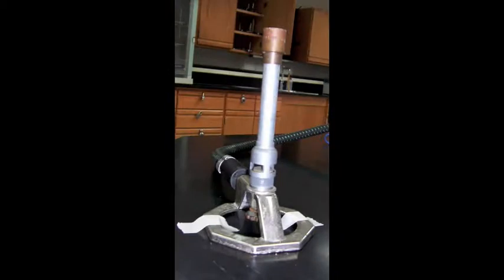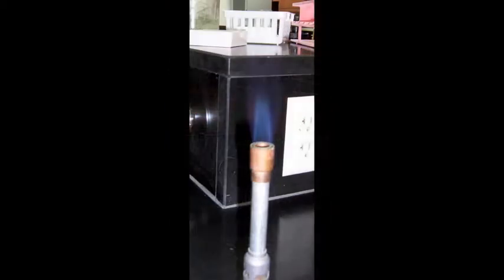Now, light your Bunsen burner and adjust the flame so that you have a nice inner light blue cone.